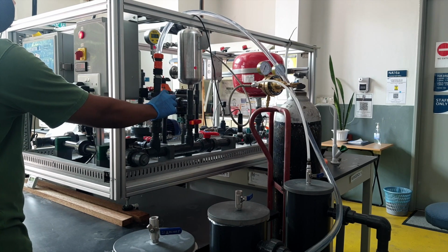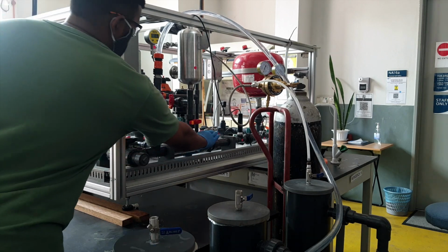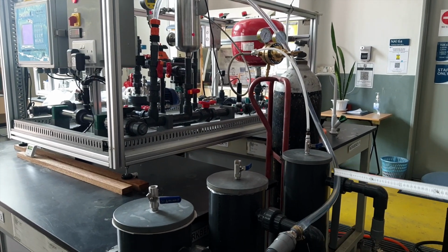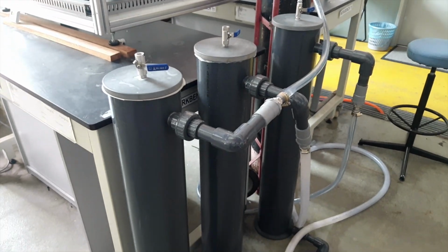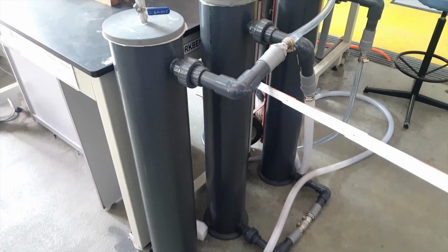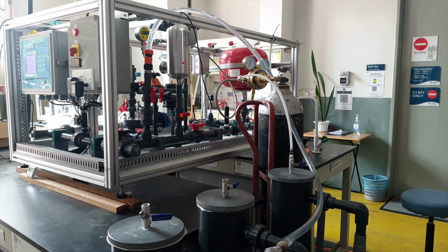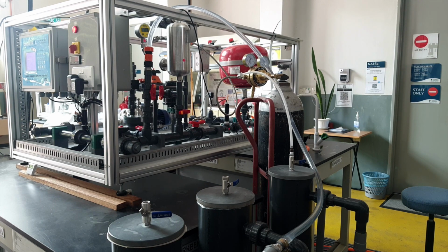So we're now putting water through the open loop system. Water is taken from the mains at 1 bar and passes through the first reactor and to the bottom, across the bottom, and then up through the second reactor, around the loop, and then up through the third reactor and out through the top. And it then passes across the same analyzers that we previously had.